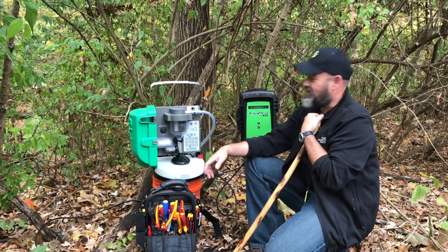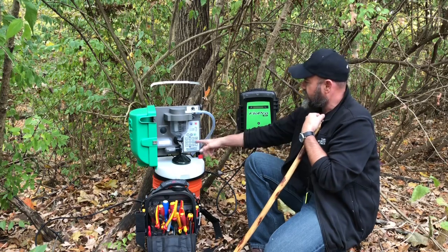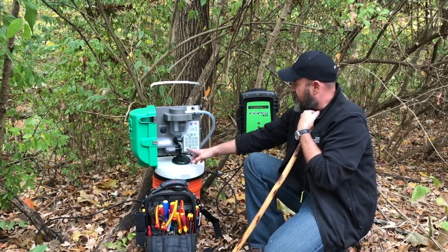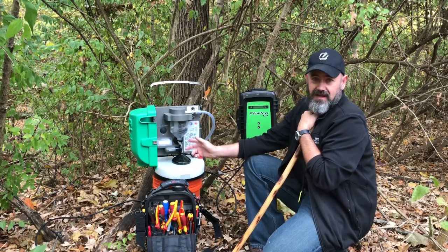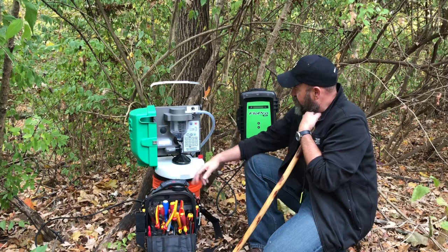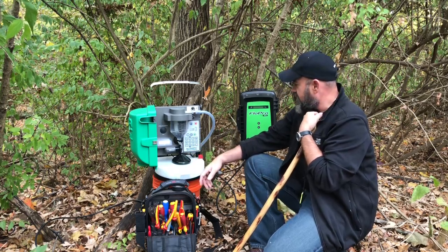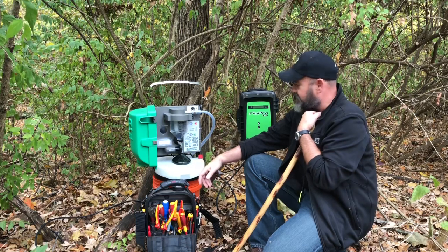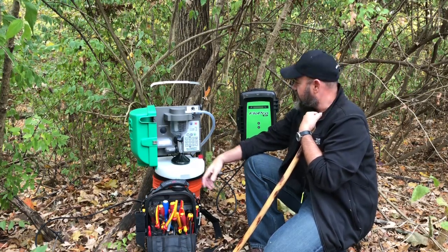The flow's just kicked off, but the basic idea is that this sends a flow pulse over to the sampler. The sampler then takes that flow pulse and converts it into a sample. You see the water going up in the sampler. It's taking about a 100 ml sample, and in this case, I think it's about every 5,000 gallons, it'll go ahead and take a sample.